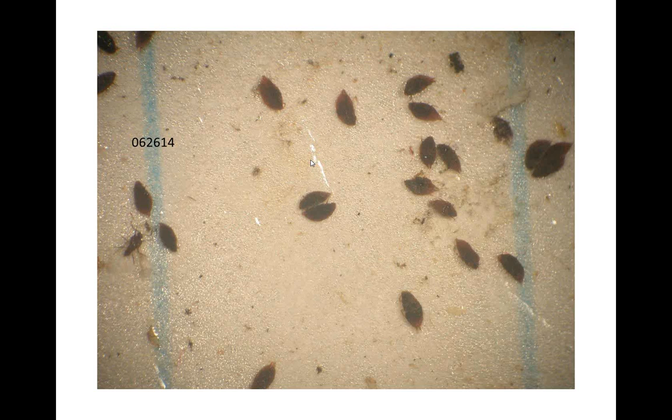You have discrete areas marked with the blue lines on a ruled piece of paper, so you can pick as many of those as you want and count and estimate then for the total. Yeah, you could number them and randomly sample them, and say that you're going to sample a third of the tape. Because I wonder how valuable it really is, when it's numbers that high, to spend the time to know exactly how many they are when you can just estimate, and it probably is a reasonable estimate.